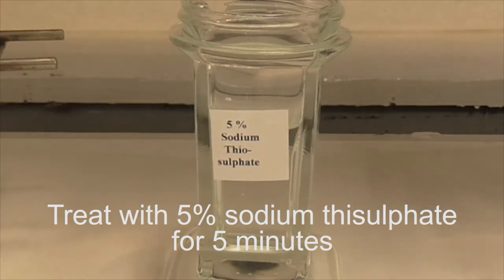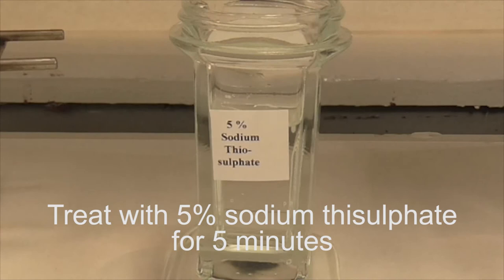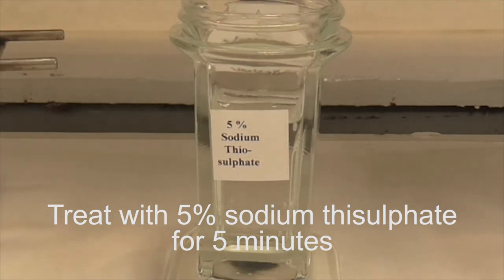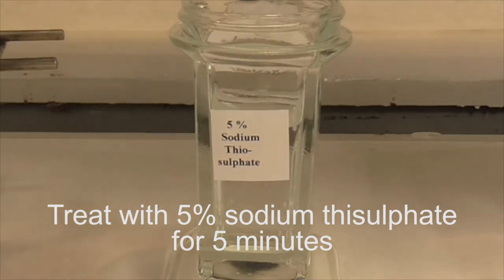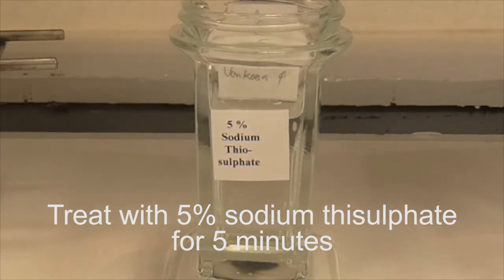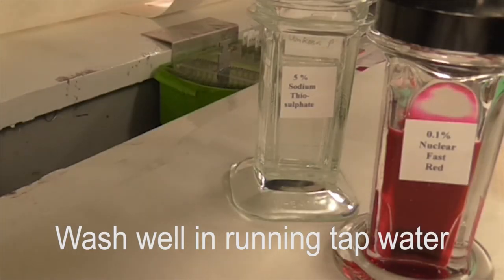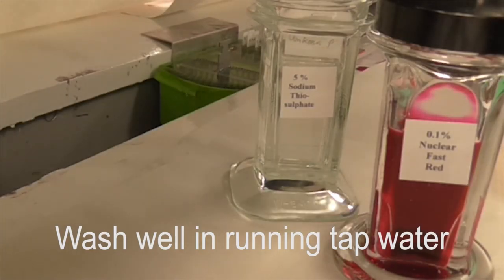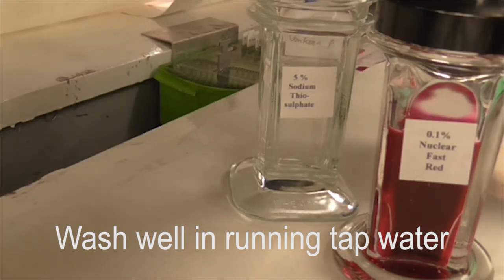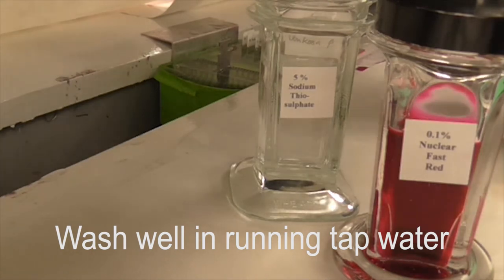Treat the sections with 5% sodium thiosulfate for 5 minutes. We will be placing them in this Coplin jar. When completed, wash them well in running tap water.